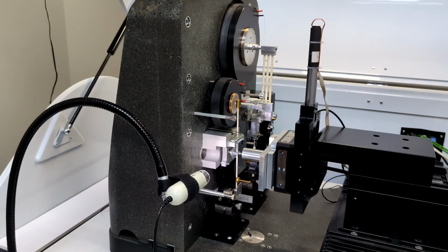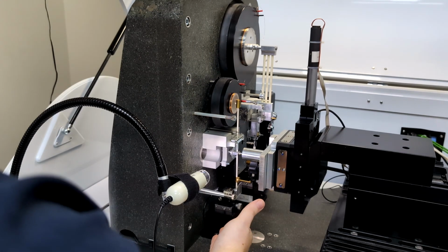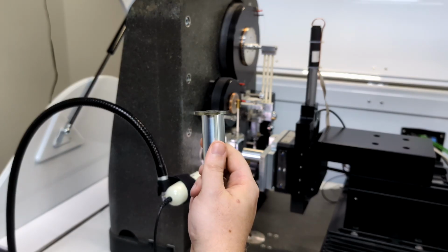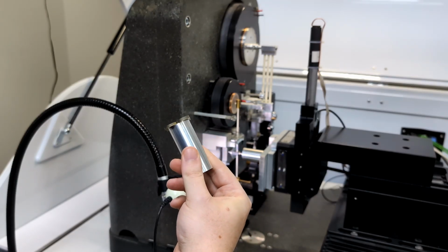The initial setup of an impact test is quite similar to an indentation test in terms of sample mounting. First, we set up the electromagnet here at the bottom to be the correct distance away from the load head in order to achieve a consistent acceleration distance and therefore impact energy for each test. Now we can install the sample using the standard sample stub for the NanoTest platform. Here we can see multiple samples installed.